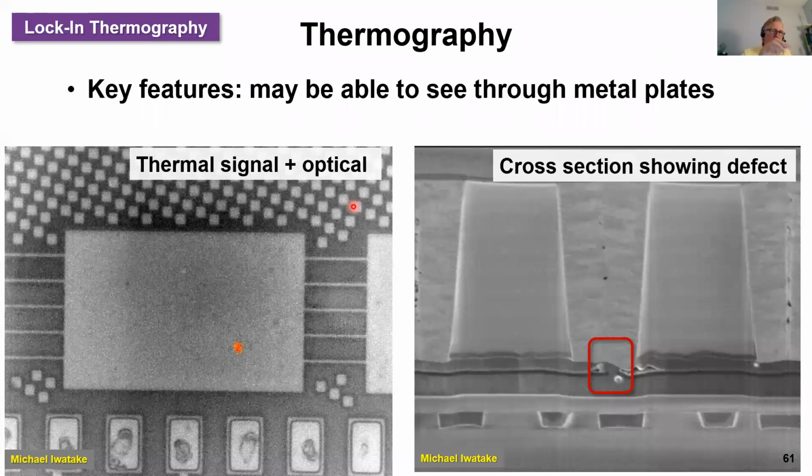The next concept we'll be going into in greater detail is lock-in thermography. And one of the key features is that it allows you to see through, you have almost X-ray vision right through metal plates. And here's a case where we've localized a defect looking through a metal plate, whereas the cross-section shows our defect.